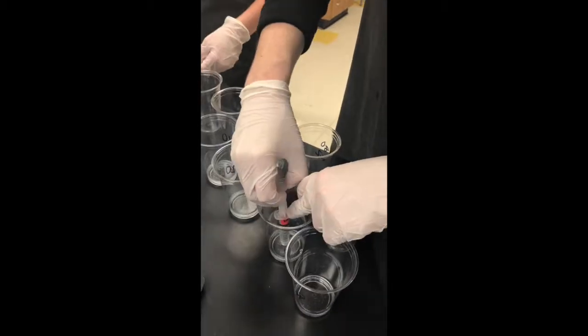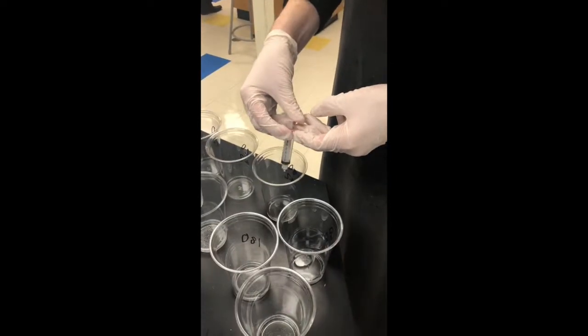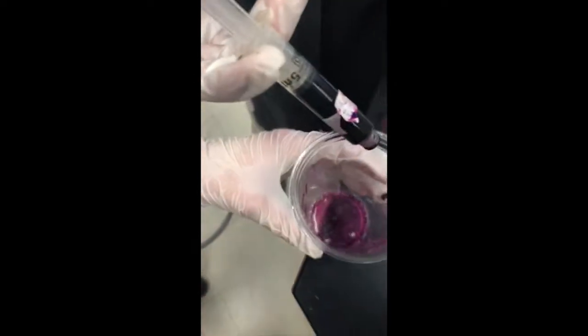We then collected 5 milliliter samples from the 7 resulting solutions in order to begin the titration portion of the procedure. Each 5 milliliter sample would be titrated with KMnO4. The titration would be stopped when a permanent pinkish-brown color change was exhibited. And then the total amount of KMnO4 added would be calculated in order to determine how much H2O2 was catalyzed during the different time intervals.